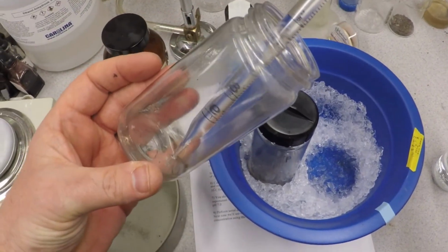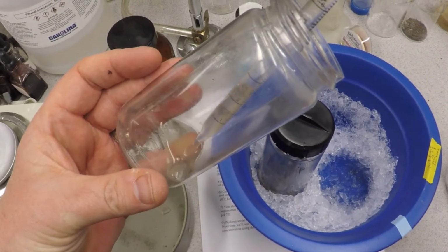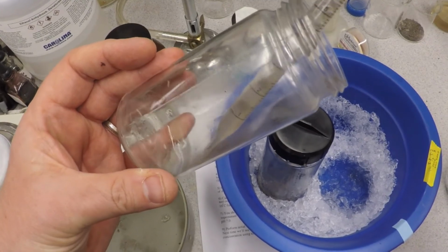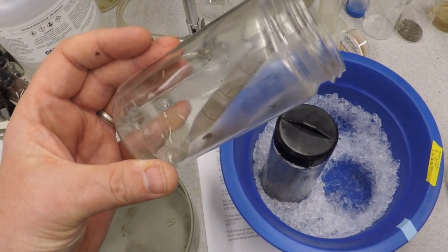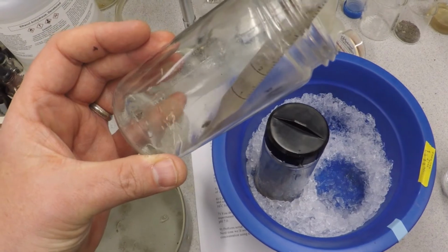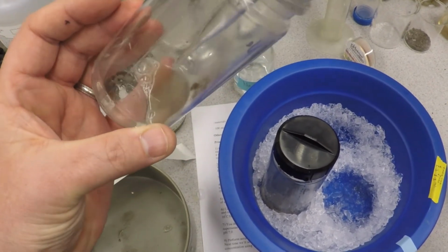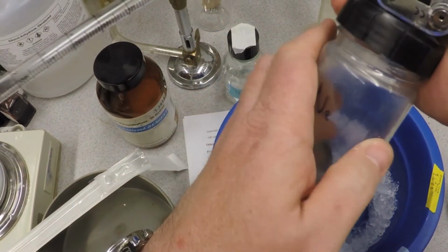And so we're going to take this and we're going to repeatedly shoot out and suck it up. Shoot it out, suck it up. Shoot it out, suck it up. Notice I'm trying to basically wash the pellet and I'm dissolving it as I go. So that pellet, that's bacteria that's on the inside bottom, is being kind of dissolved in this buffer. And you do that a few times until you're satisfied that you have resuspended the pellet, which I'm pretty satisfied. Yeah, baby!